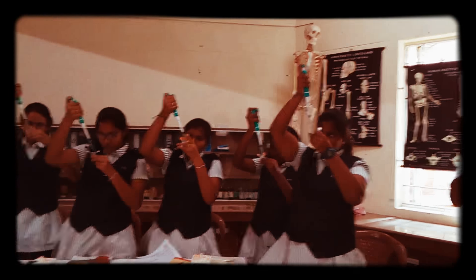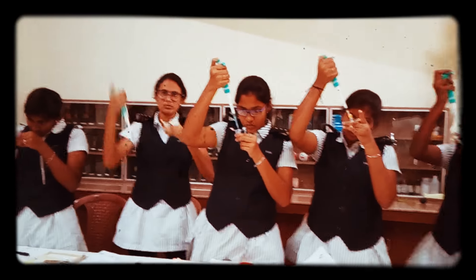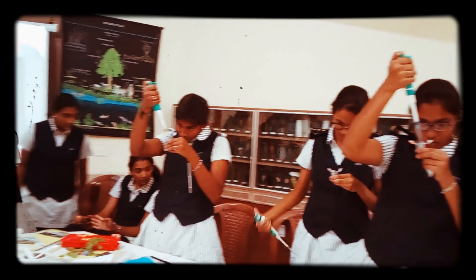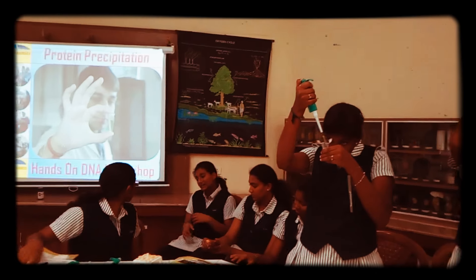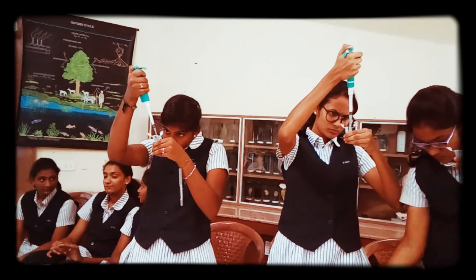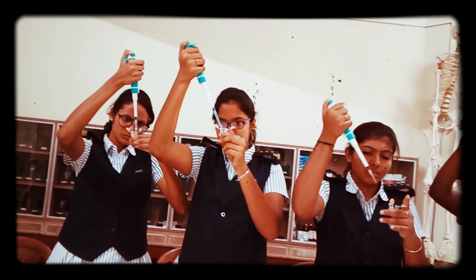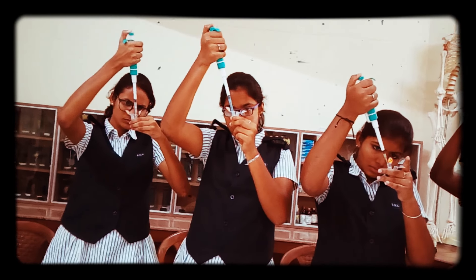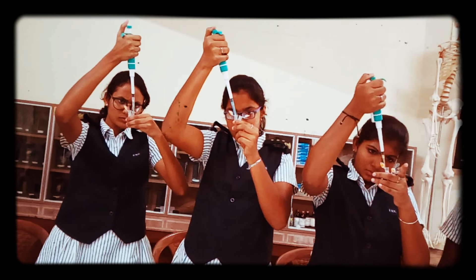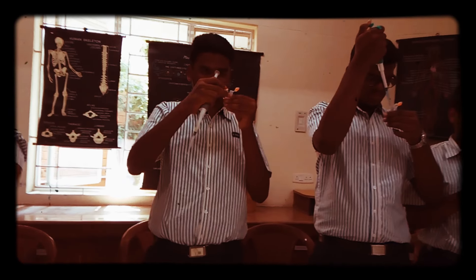Drop by drop, you have to watch the pipette tip point. Remember, the layer is a very, very thin and fine layer — you have to be careful. Safety: drop by drop, without disturbing. Impurities should not come into the next tube; a small amount may be left. Upper clear liquid only.